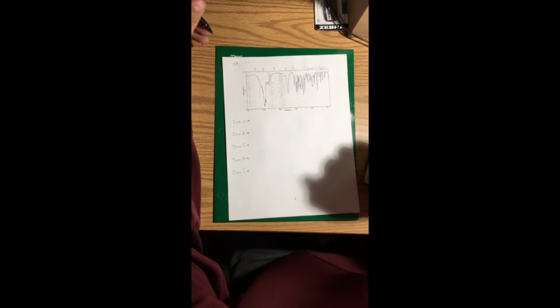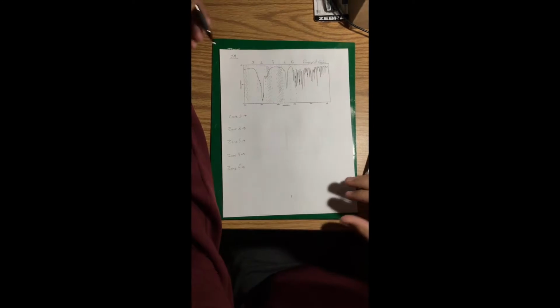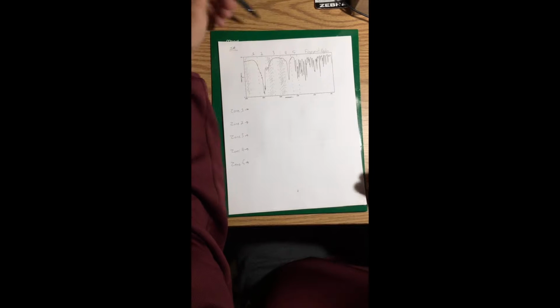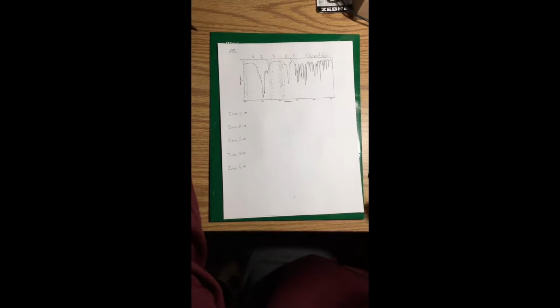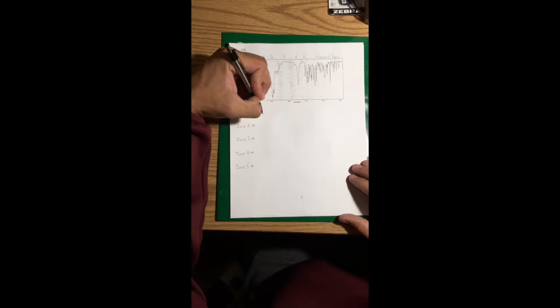Okay. So next we move into IR, which you can see is breaking down into zones. We're looking for the transmittance of a lower level. There are 5 zones in it, and also the fingerprint region. You don't have to worry about the fingerprint region unless you absolutely want to do it. So I'm going to break down the first zone. As you can see, there's no dip down towards the 0, so I could qualify for nothing.